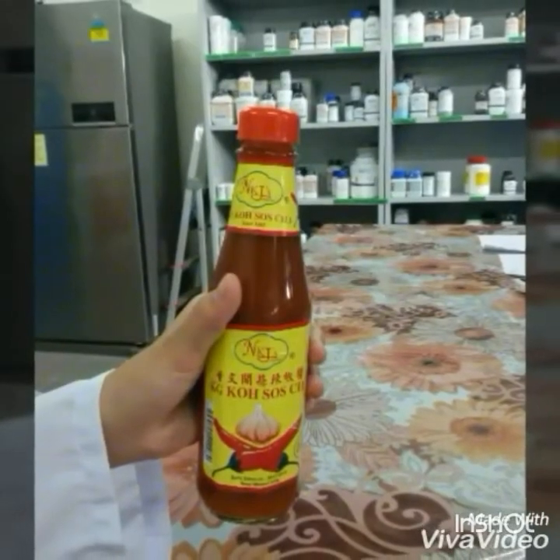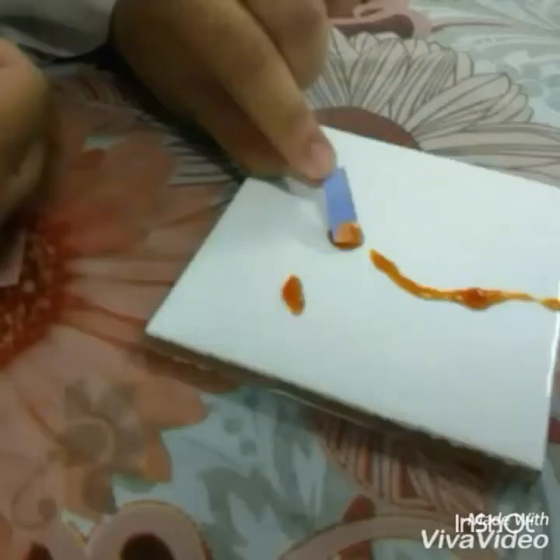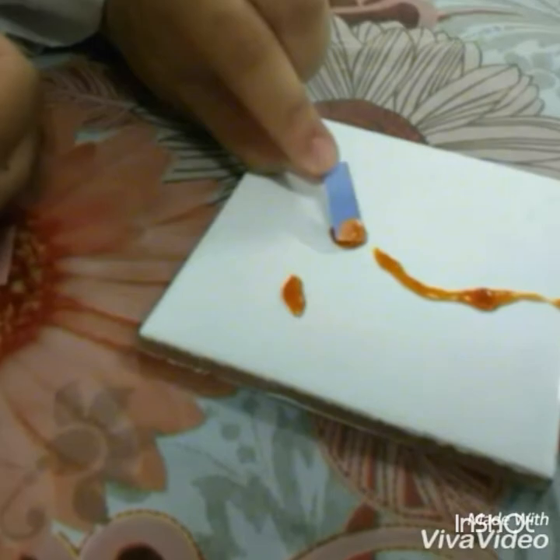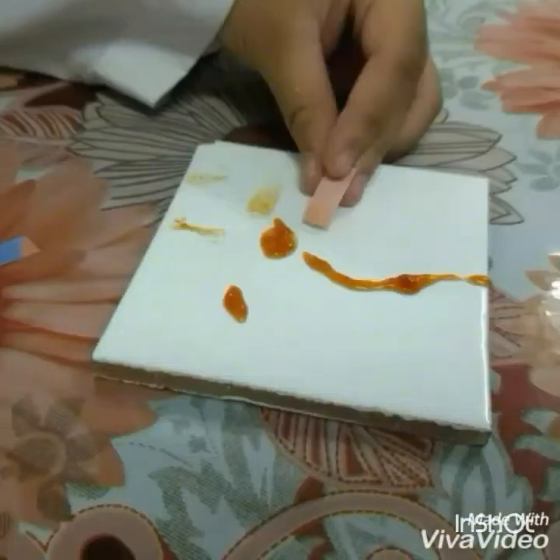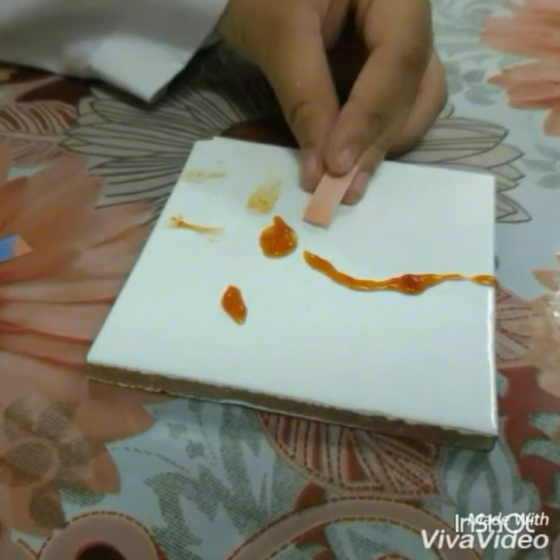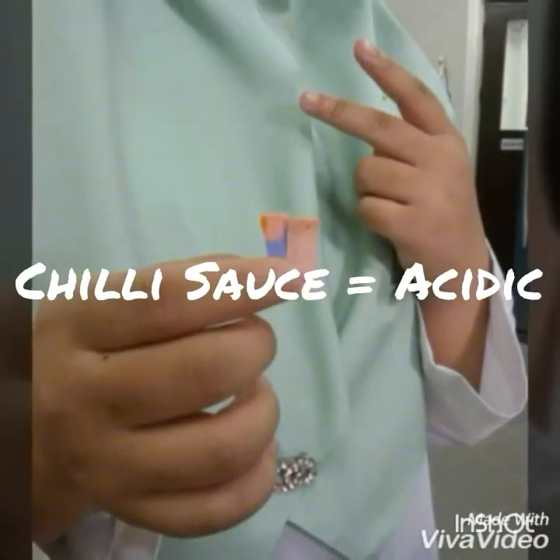Fourth sample is chili sauce. We poured a little bit of it onto the white tile and we dipped the blue litmus paper. Next the red litmus paper. But with chili sauce, to confirm the results, you have to wipe the sauce off both the papers.